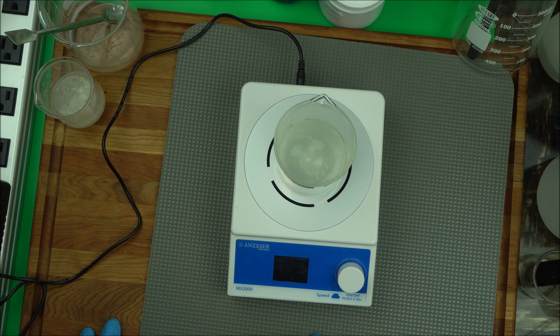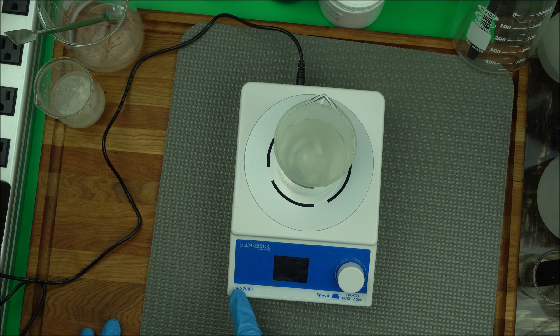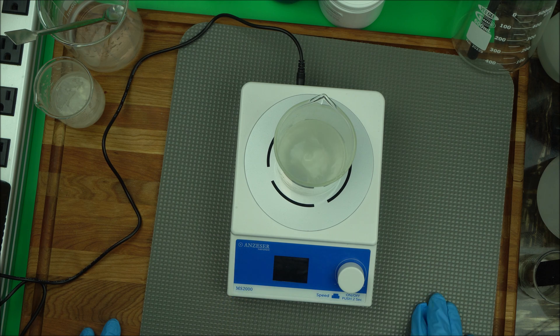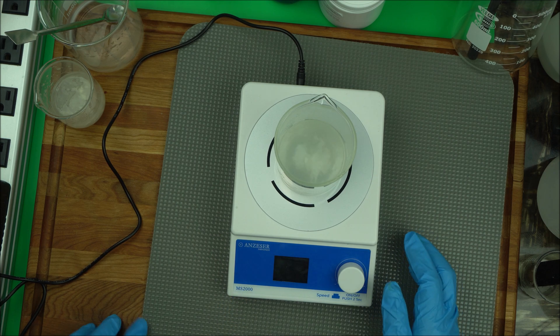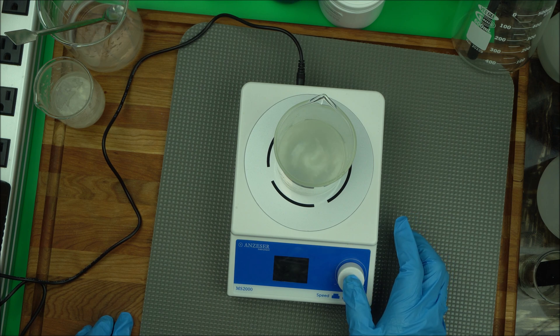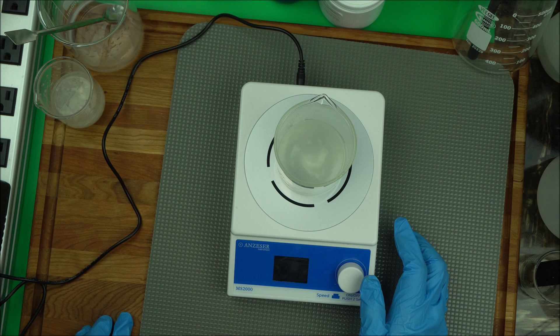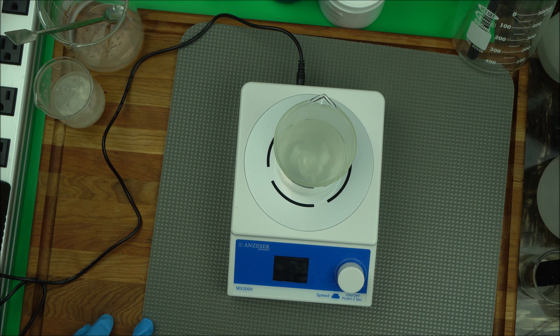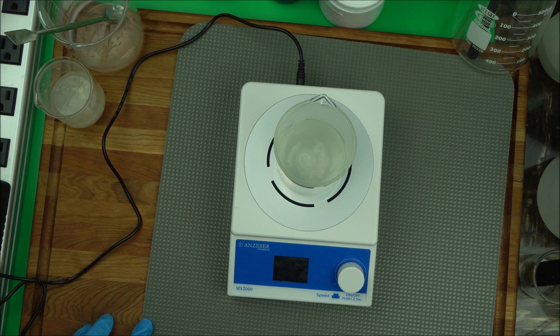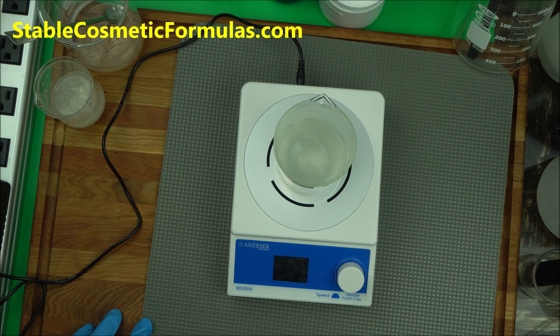2000 is the max for this, that's why it's called 2000, but I'm at 1700. Then you're going to let it run for at least five minutes. After that we're going to stop it, then you're going to see exactly what you have.